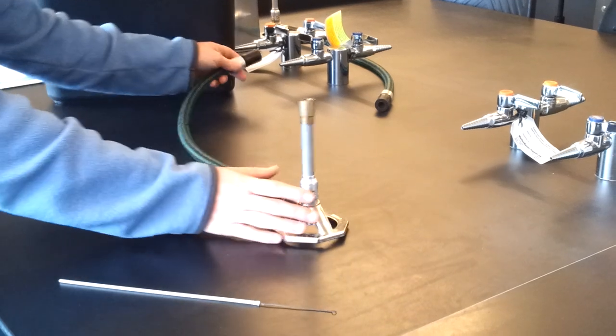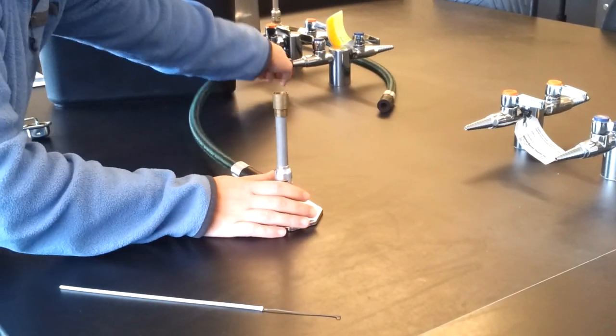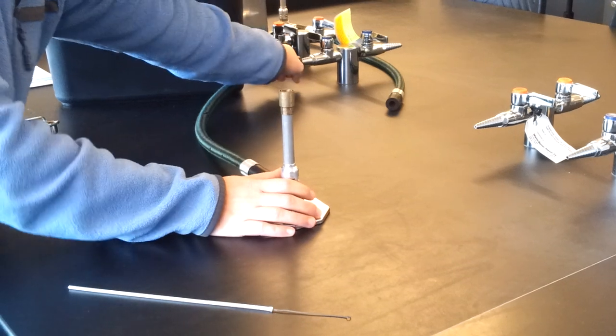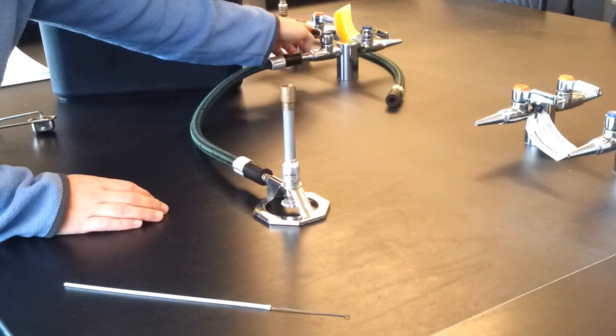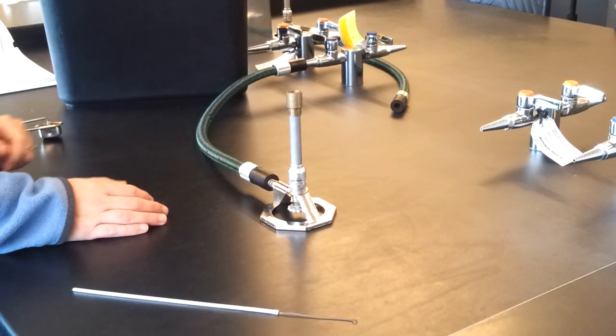You're going to attach it to the gas nozzle like this, and I really push it on there pretty tight. When the gas knob is perpendicular, that means the gas is off. When you pull the gas knob parallel, that means the gas is on.